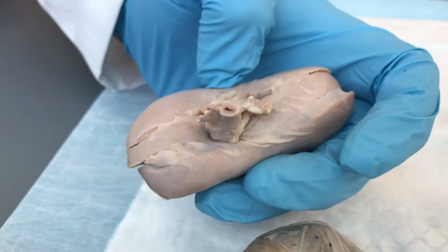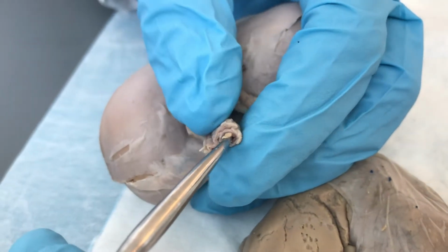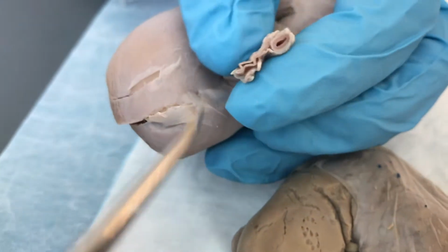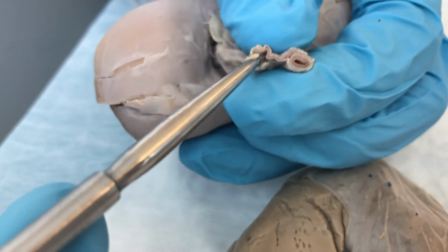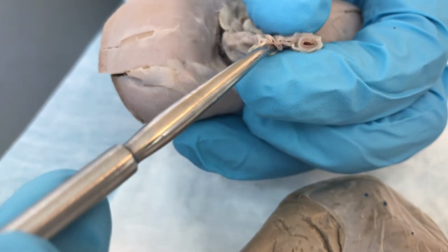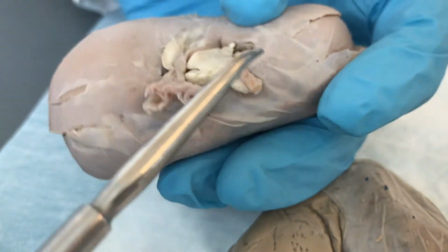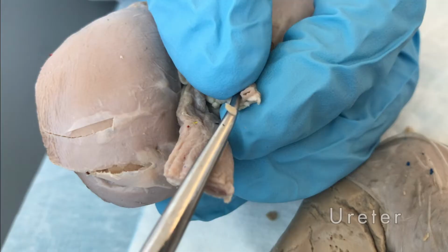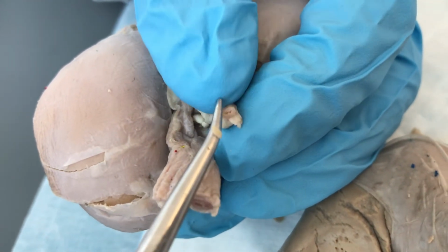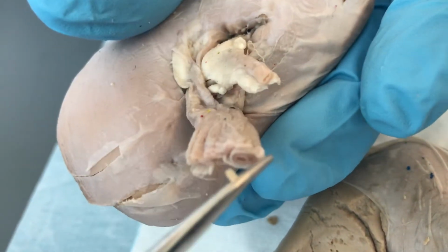As we observe the walls and the caliber of each with a probe, we can observe that the renal artery has a much thicker tunica media, and that accounts for its rounder lumen. The vein has a much thinner tunica media, and that accounts for the more floppy lumen. The ureter has a distinct lighter colored tunica adventitia with the smallest lumen. The small size of the lumen is understandable because the volume of the urine passing through the ureters is much less than the volume of blood carried by the arteries and veins.